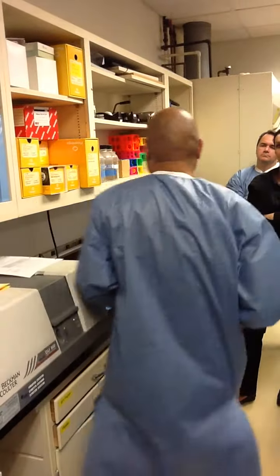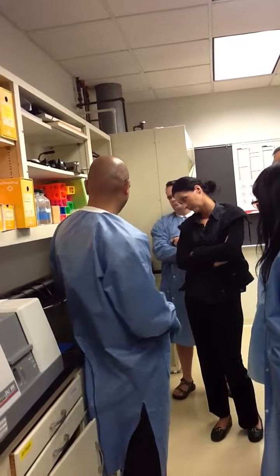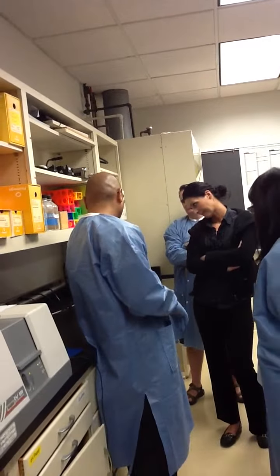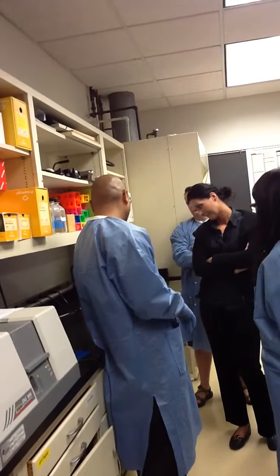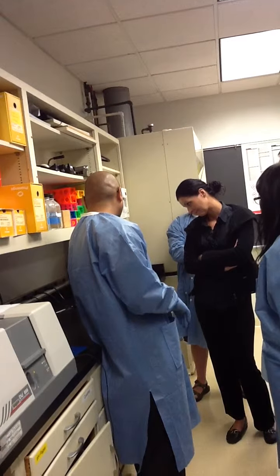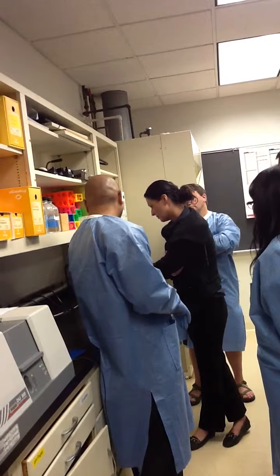Now this PCR is a really cool one because it allows you to visualize the step increments for the temperature. 94 is high. This is a hot start. 94 for 30 seconds, which is the first of the 3 steps. Then down to 52 for the annealing and 72 for extension. Repeat back again for 40 cycles.